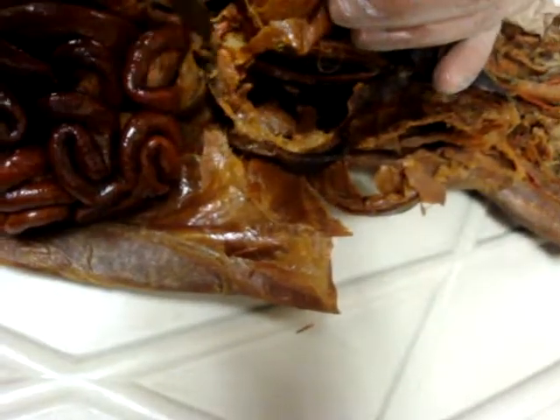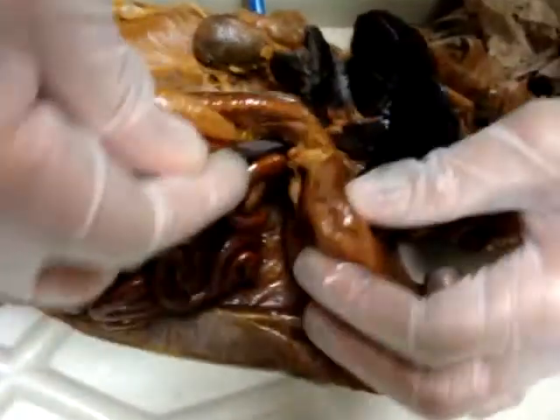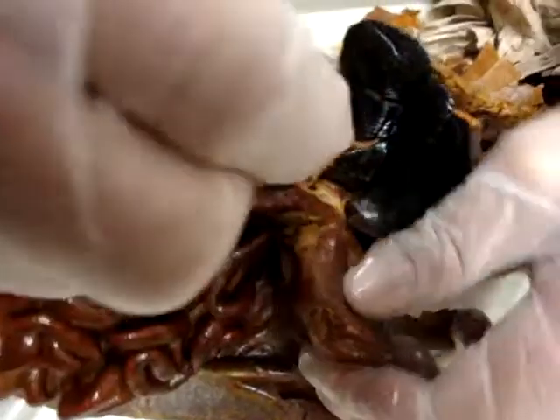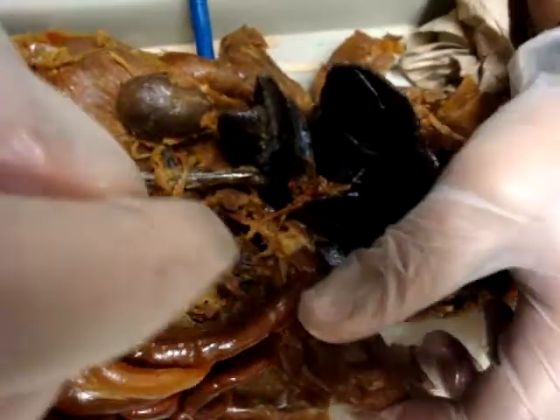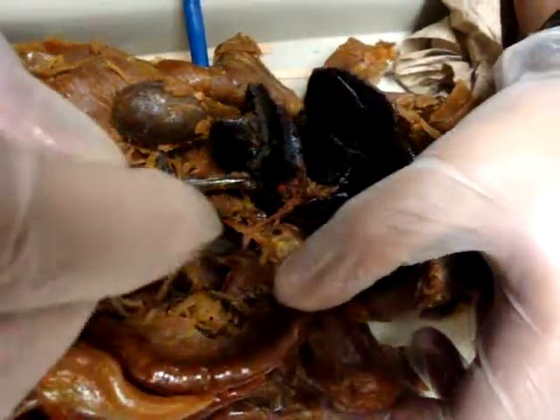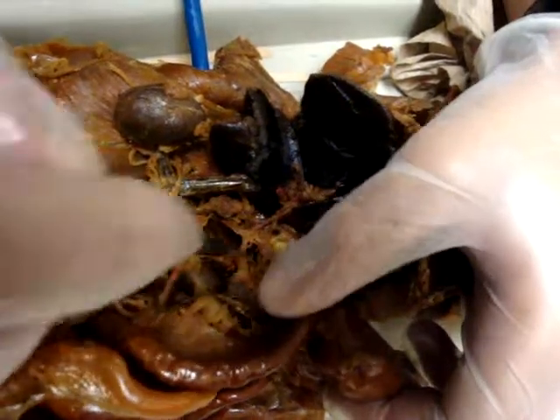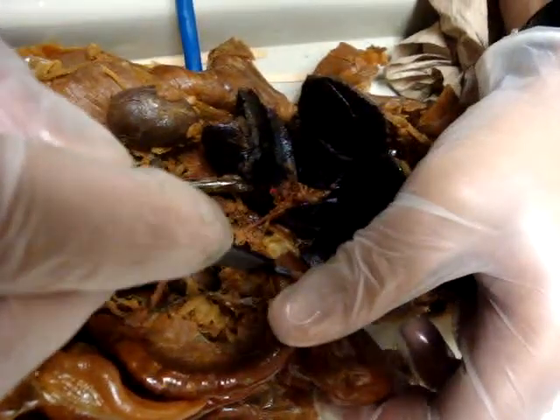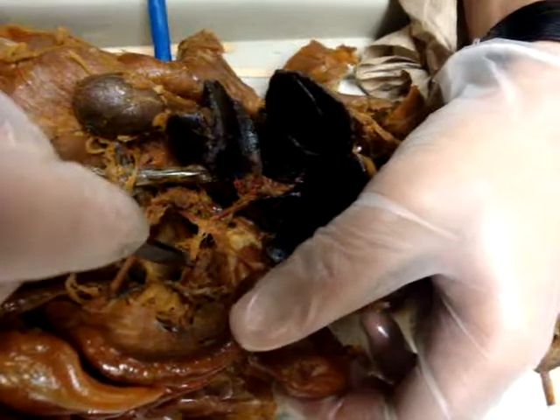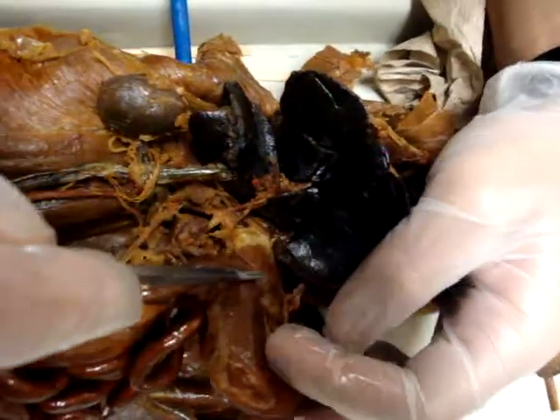Right here — see if we can follow it. So I think it's the splenic artery, common hepatic artery, splenic artery right here? No, that's the descending aorta.